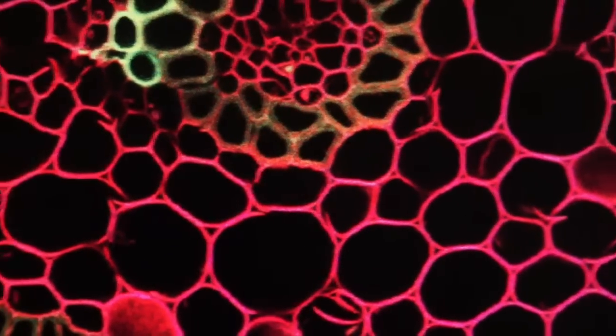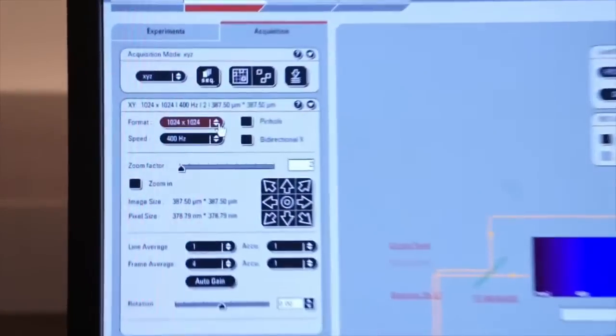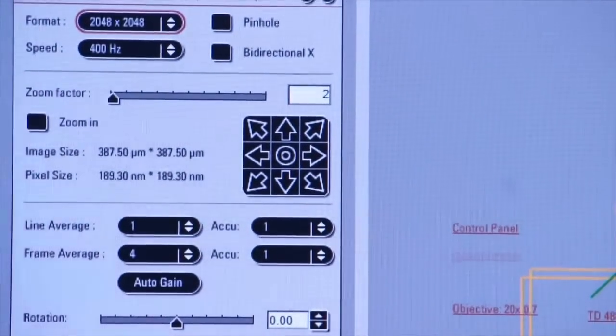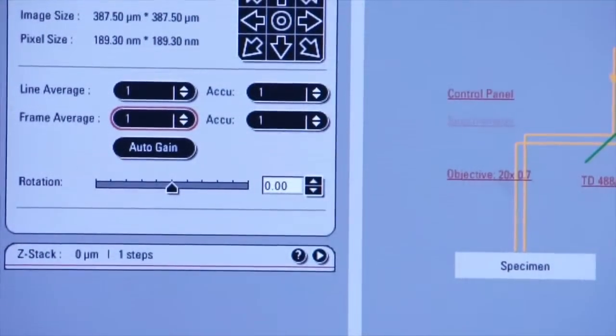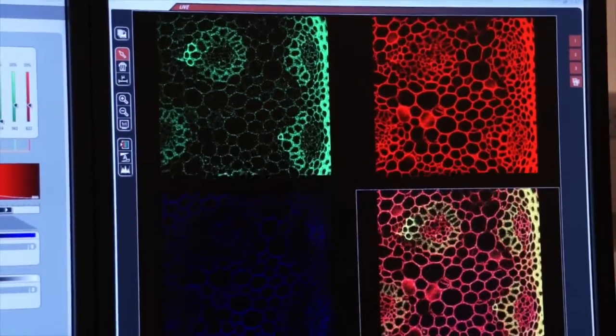Let's try it again, only this time we're going to increase our resolution even more. So I come up here to resolution. Let's do a 2K by 2K image. And we will change frame averaging back to 1. Let's just capture an image at 2K by 2K. And you'll see how grainy this is.